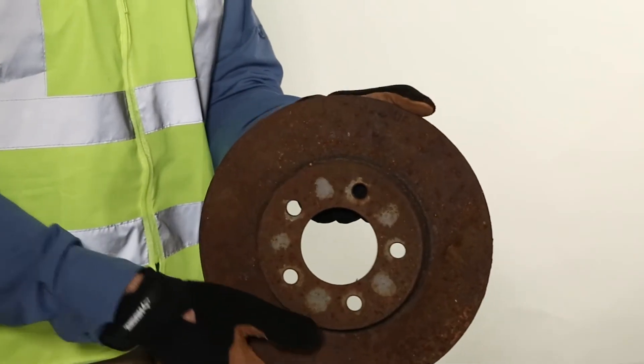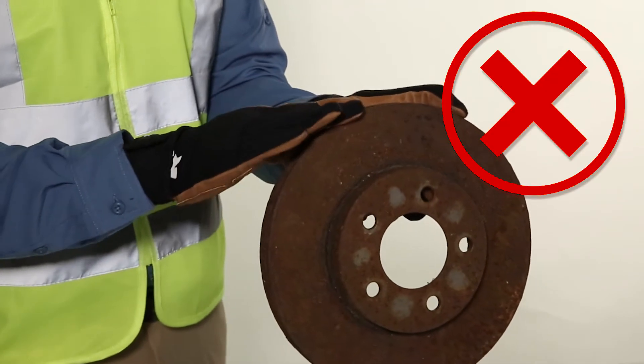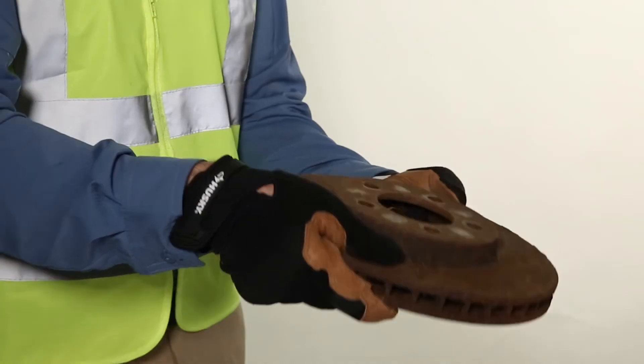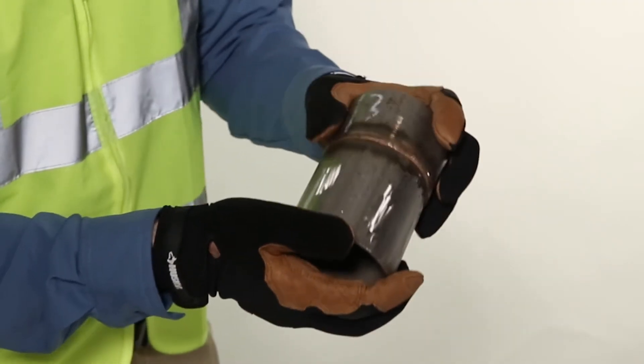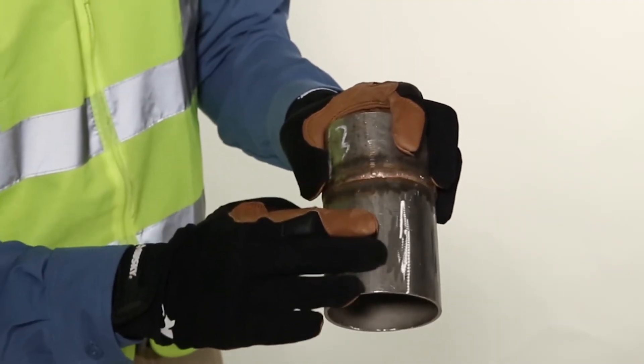To begin sample preparation, start by confirming acceptable testing locations. Locate a flat and easily accessible area. Prepare a space approximately one square inch for easy positioning.